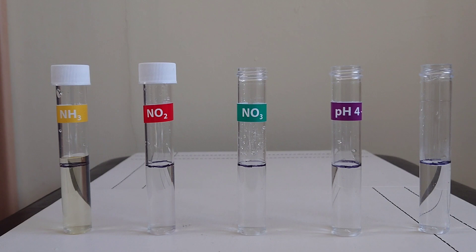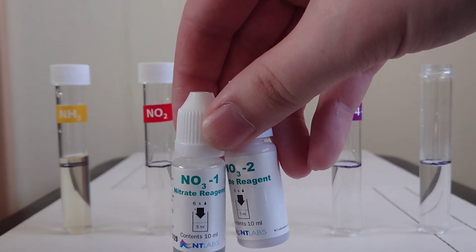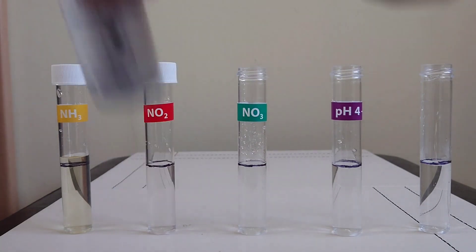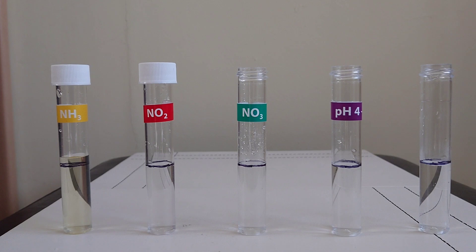Next is nitrate. This has two bottles, and the first bottle you have to make sure to give it a very hard shake for 30 seconds. I've already pre-shaken these so it's already ready to go. And for each of these it takes six drops.